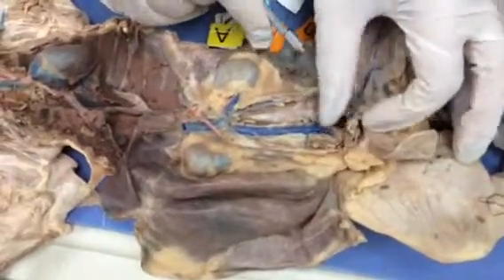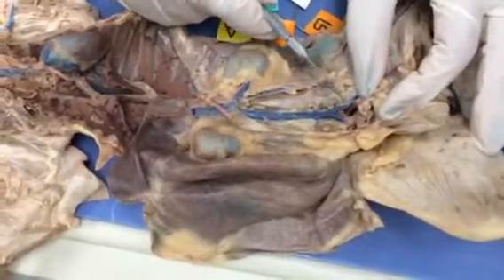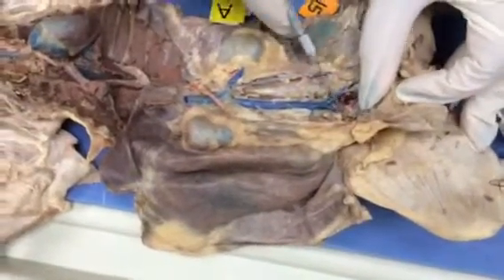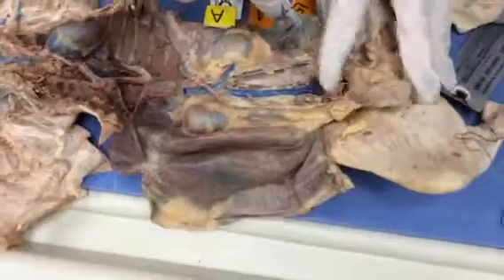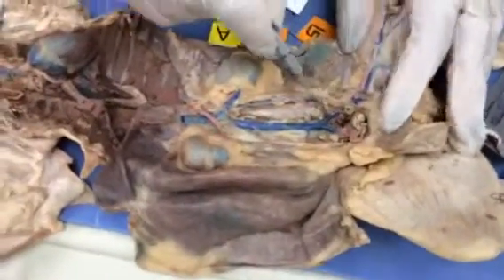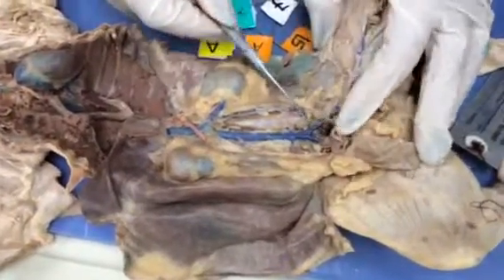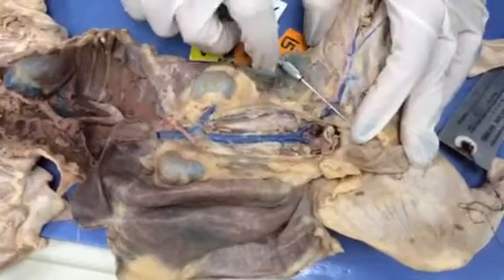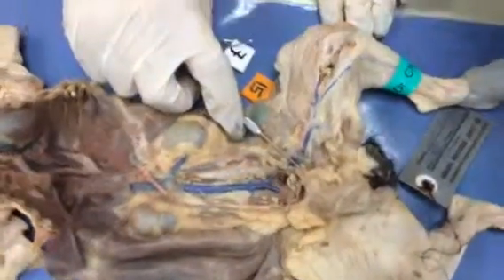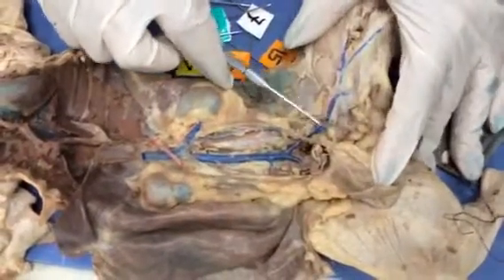This common iliac branches out into what we call the left external iliac and then the right external iliac. It also gives me the internal iliacs. They're very small caliber blood vessels, so they're hard to see in this specimen. We follow the external iliacs. Once they pass the inguinal canal, where we draw an imaginary line at the groin, it turns into the femoral.